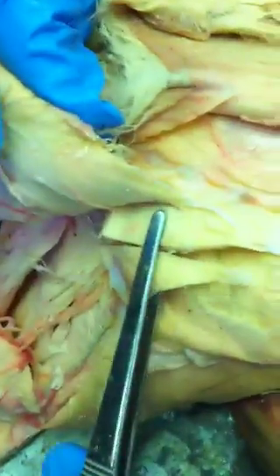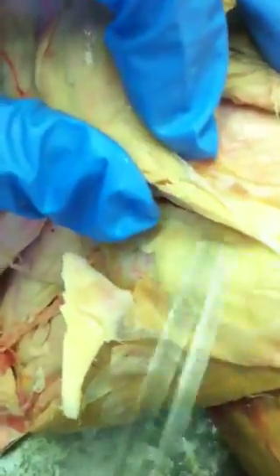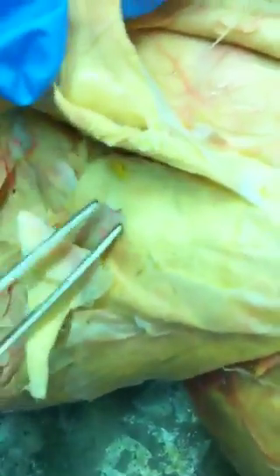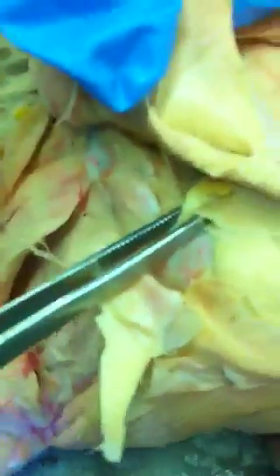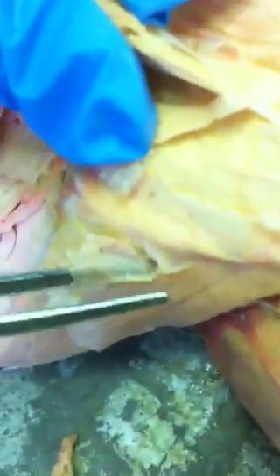Alright, right here is the gluteus maximus. Then cranially we have the gluteus medius. And this piece right here is the piriformis. And over here again is the tensor fasciae latae, separated.